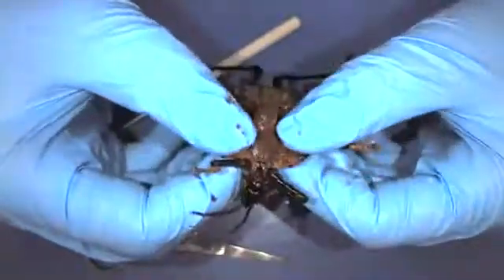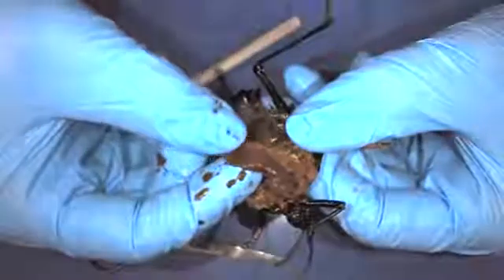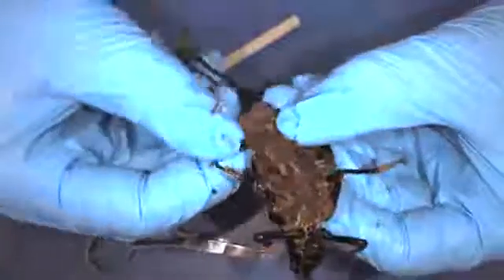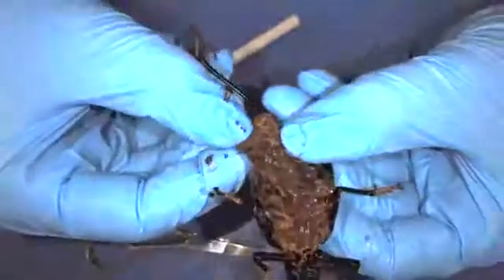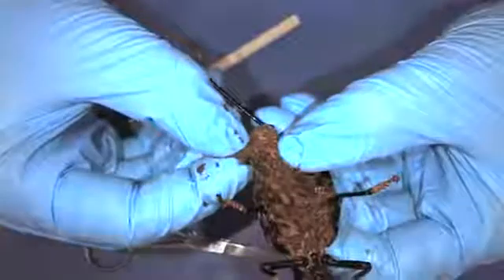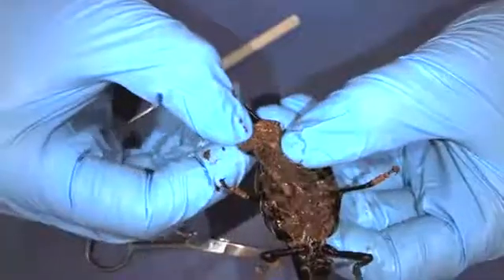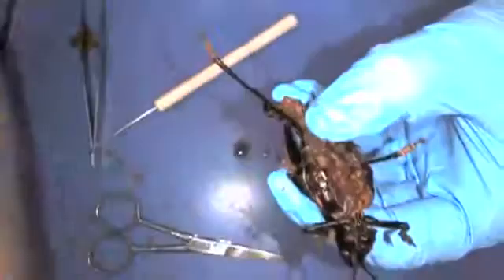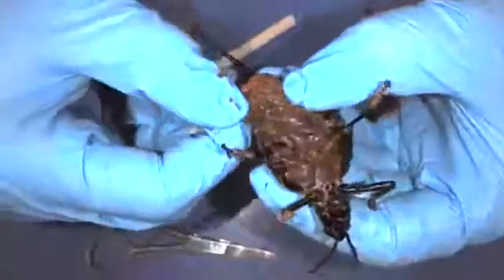This crop connects down to something called the gastric caeca, which is like a giant digestive gland — that's the kind of middle section here. Their stomach is beneath the gastric caeca. And then at the very end, these strand-like structures that are almost spaghetti-like are called the Malpighian tubes, which function just like kidneys in our body. They remove nitrogenous waste — getting rid of all the stuff the grasshopper doesn't need — and help with filtration.